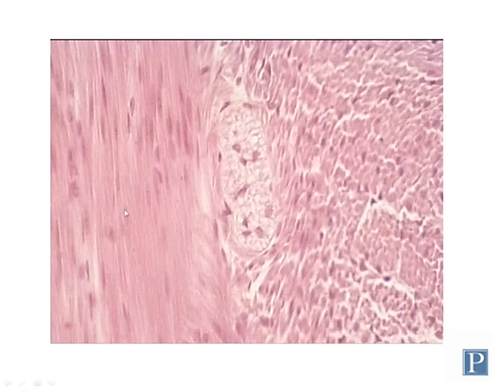Here's another layer of smooth muscle in longitudinal section. And that's because in most of the gut, you have two different layers of smooth muscle, an outer longitudinal layer and an inner circular layer. There are some exceptions, such as in the stomach, where there's actually three layers of smooth muscle, and we'll look at that in more detail when we explore the alimentary canal after the first practical.